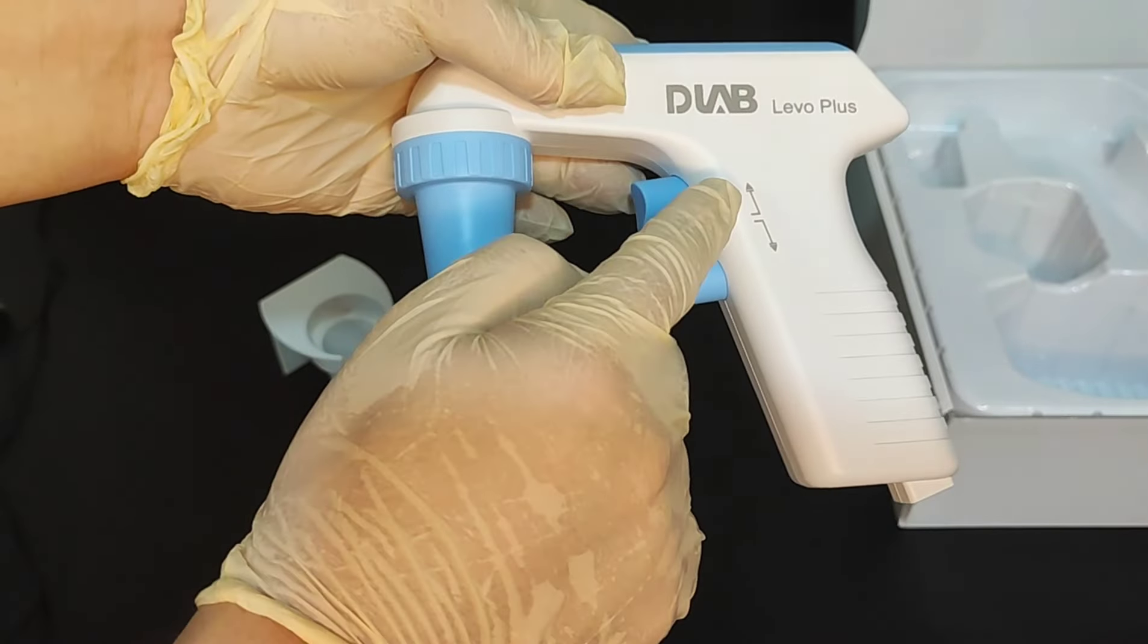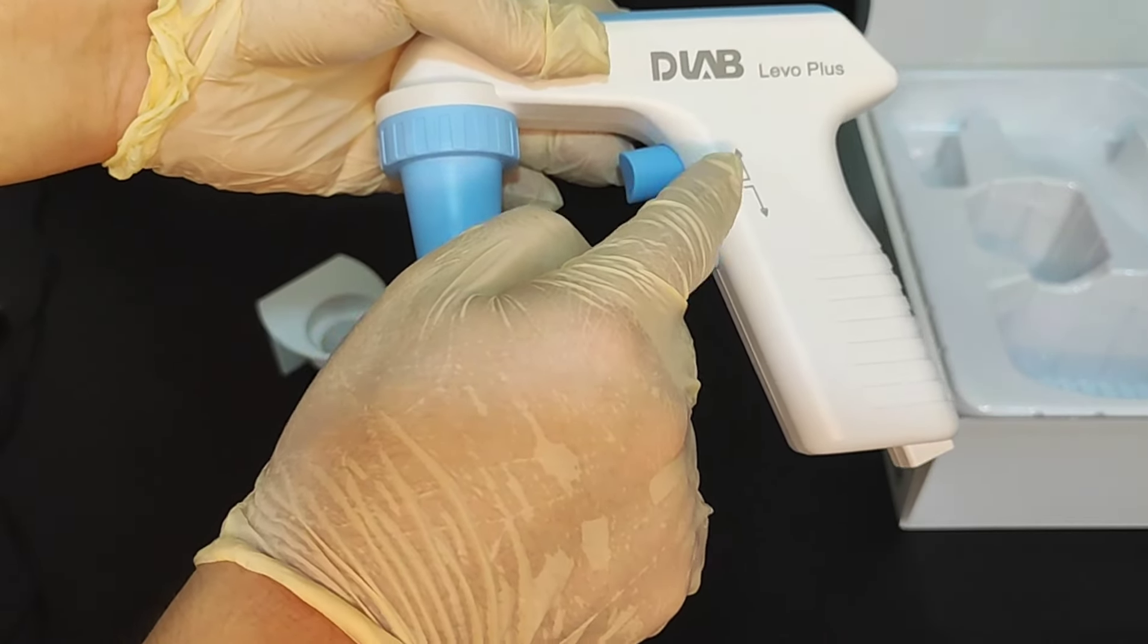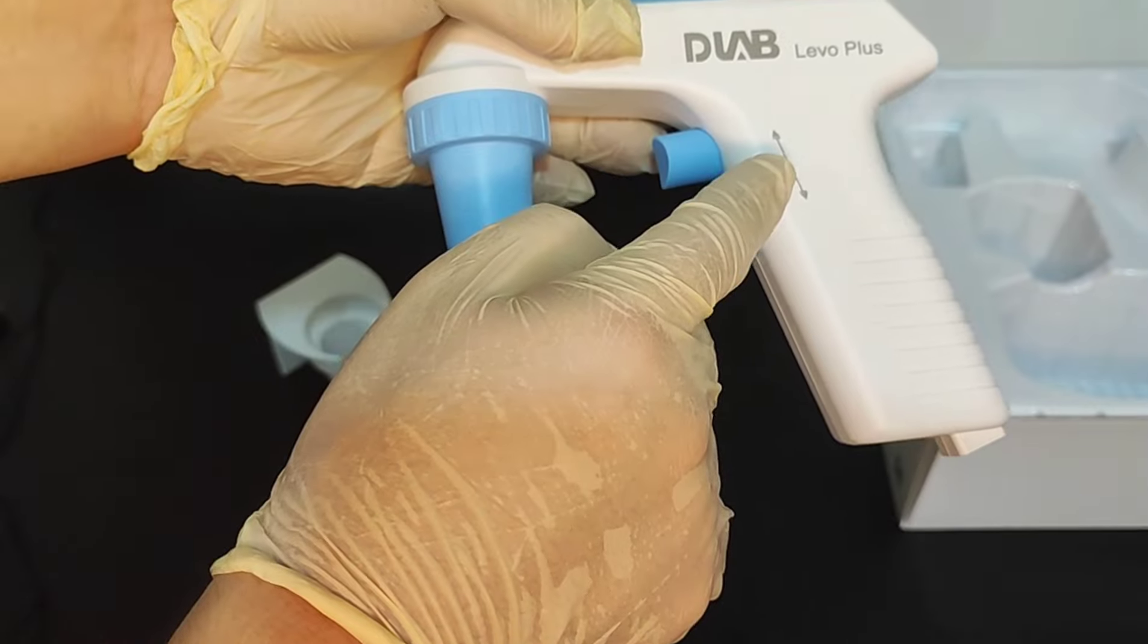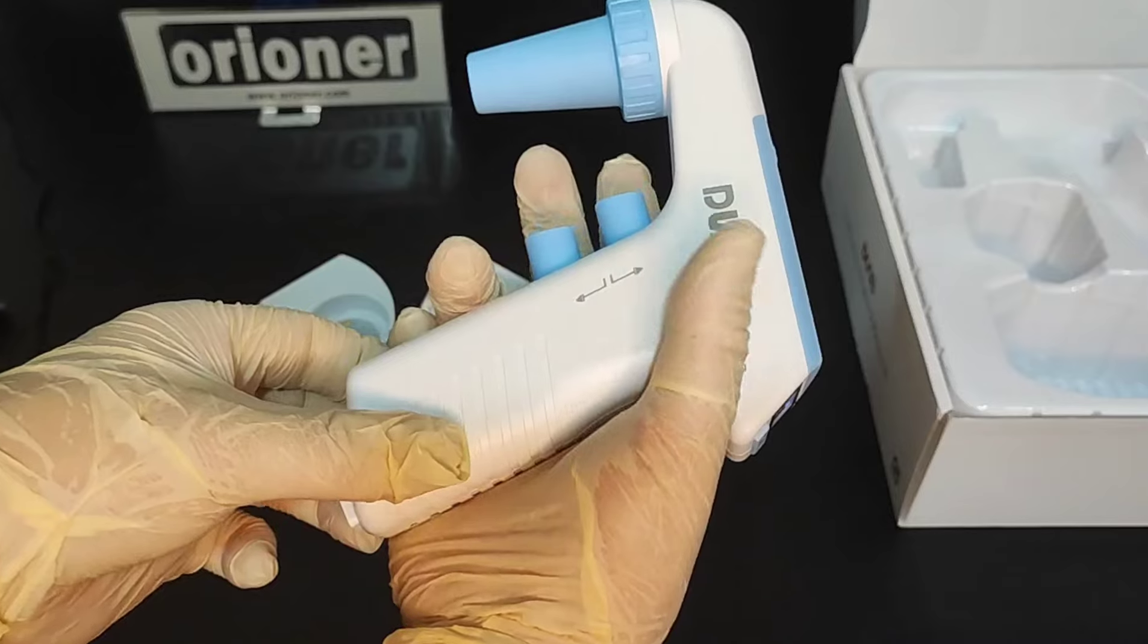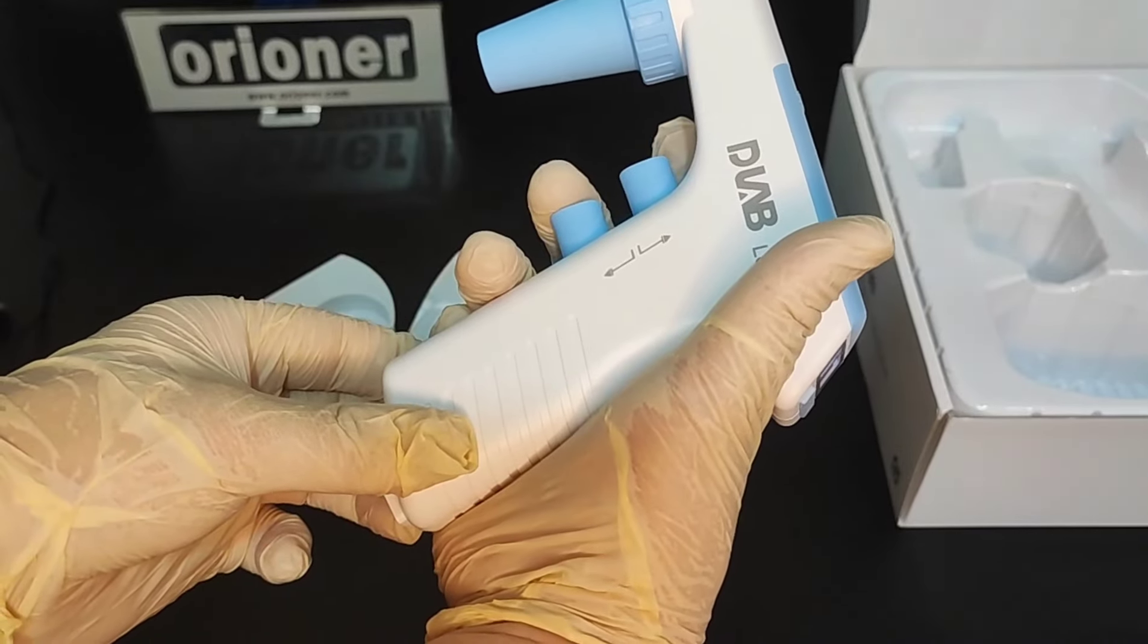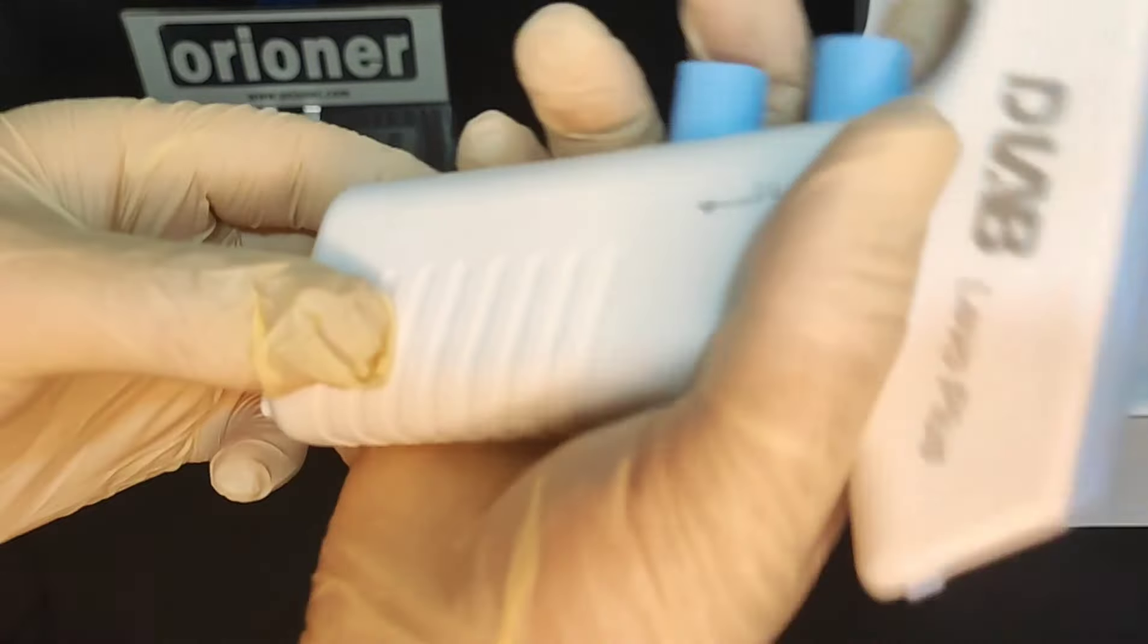From here you can see the mark. This up is for suction. Down is for dispensing. If we push up, this is for suction. And this is dispensing. You can hear the sound.